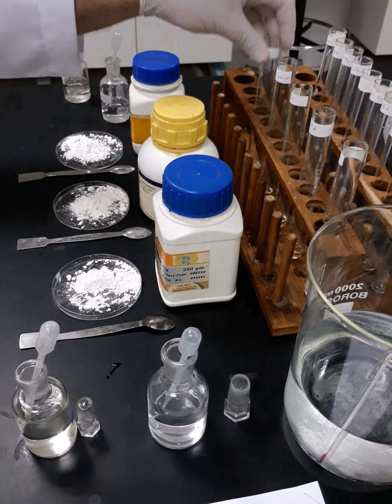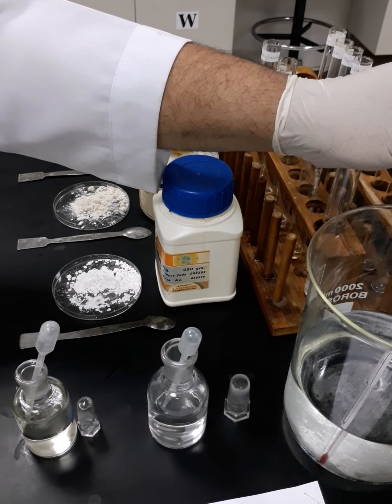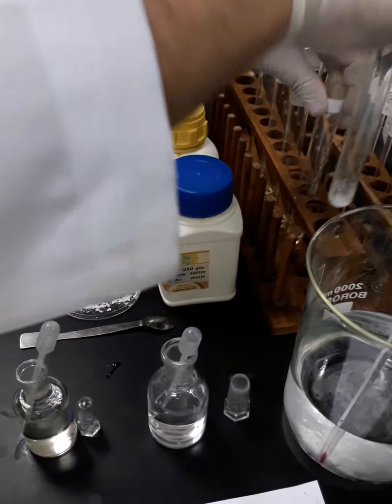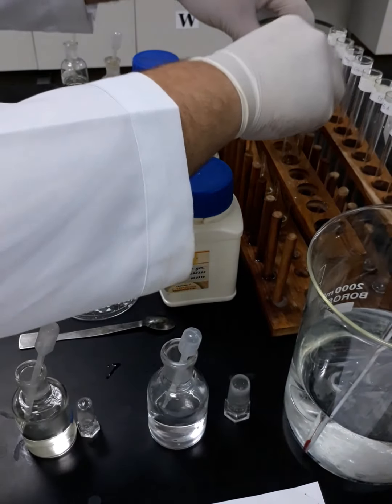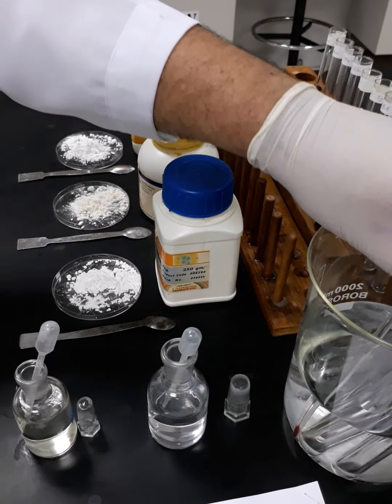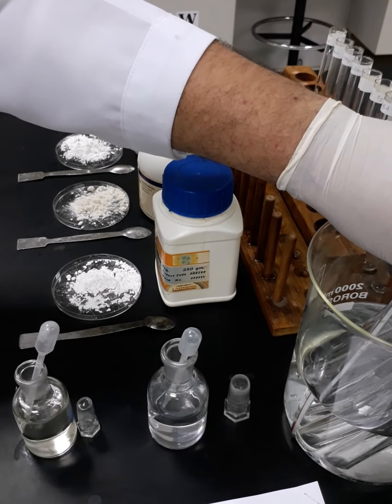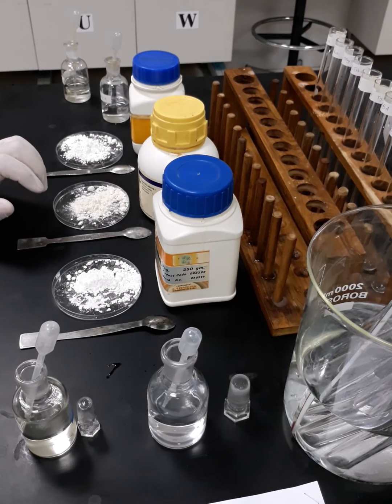Okay, now we are going to put all the test tubes inside the ice bath, but we have to make sure about the temperature. Yes, it is below 10, so I will take the test tubes and I will place them inside the ice bath. If you remember, that's why I told you we have to put the label in the upper part, so even now they will not touch the solution. Now we are going to count down for 2 minutes or 3 minutes, then we are going to proceed.